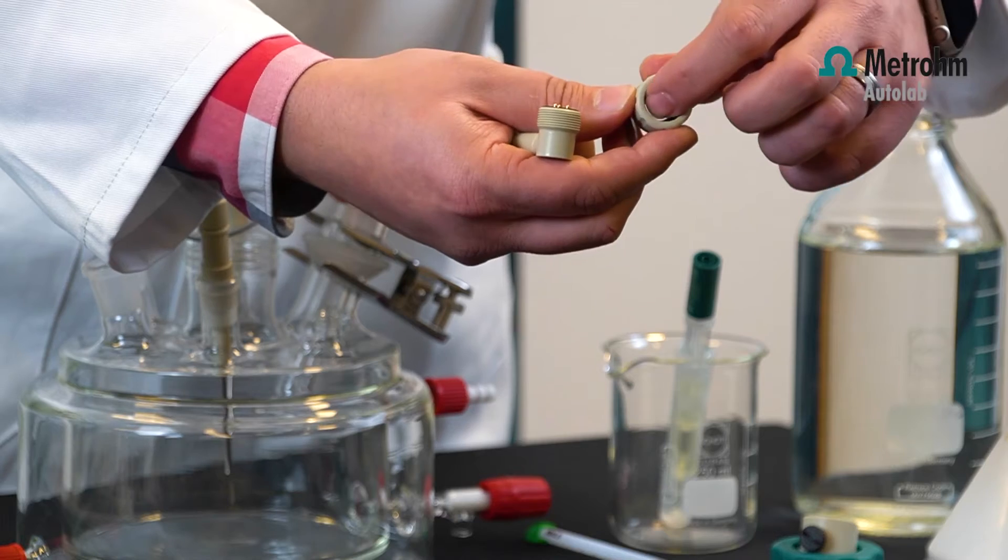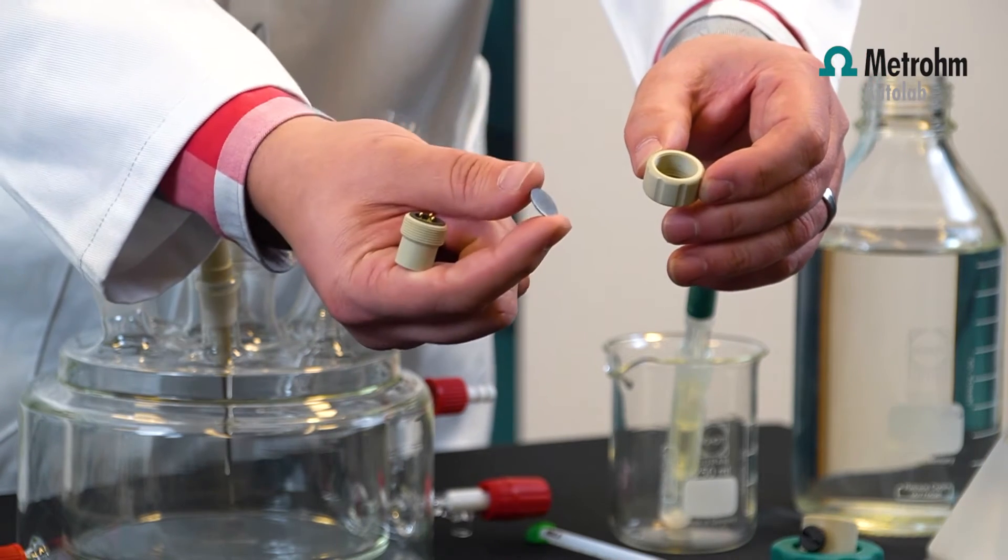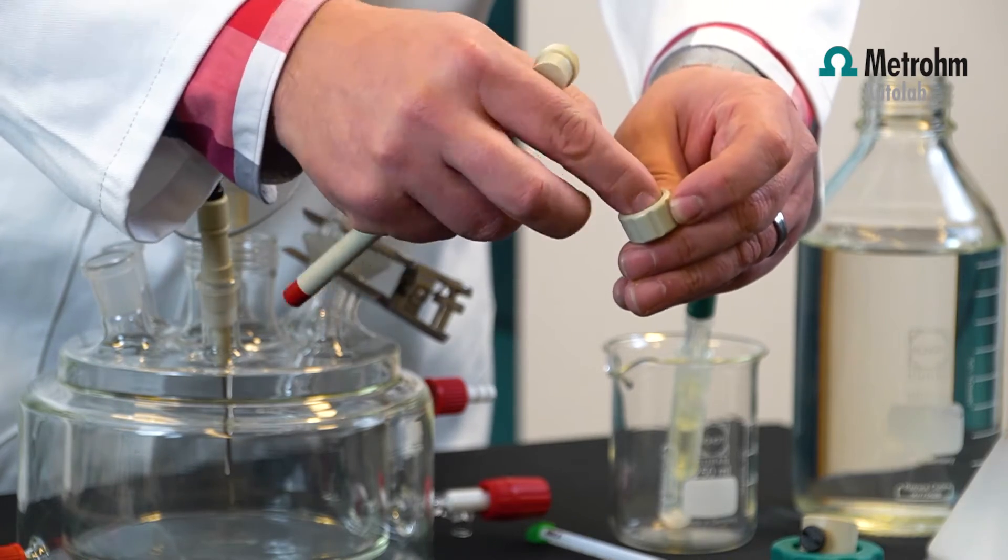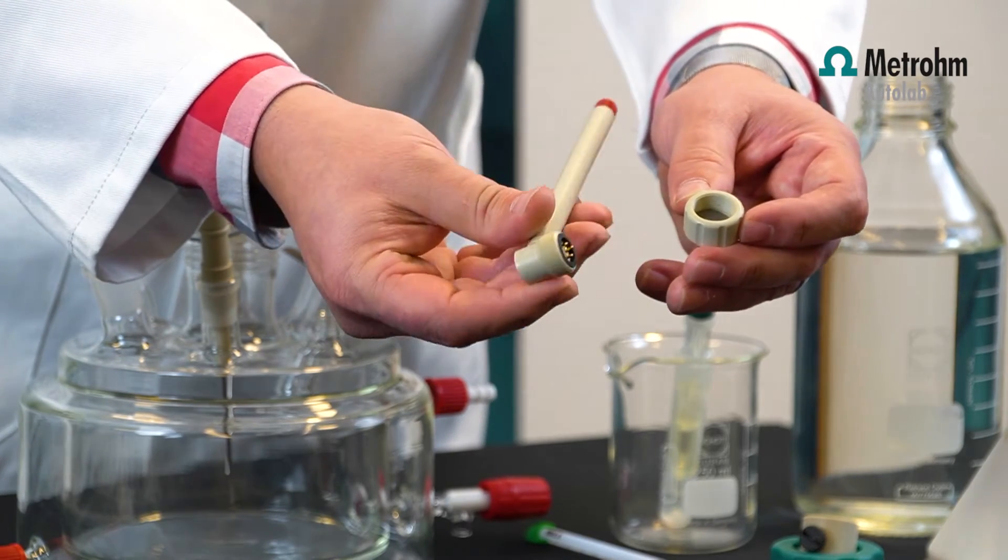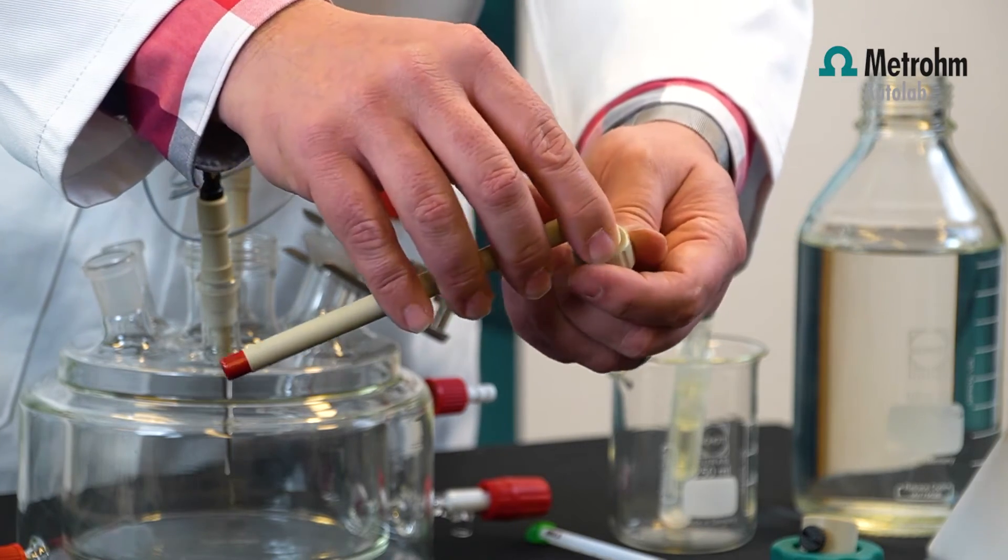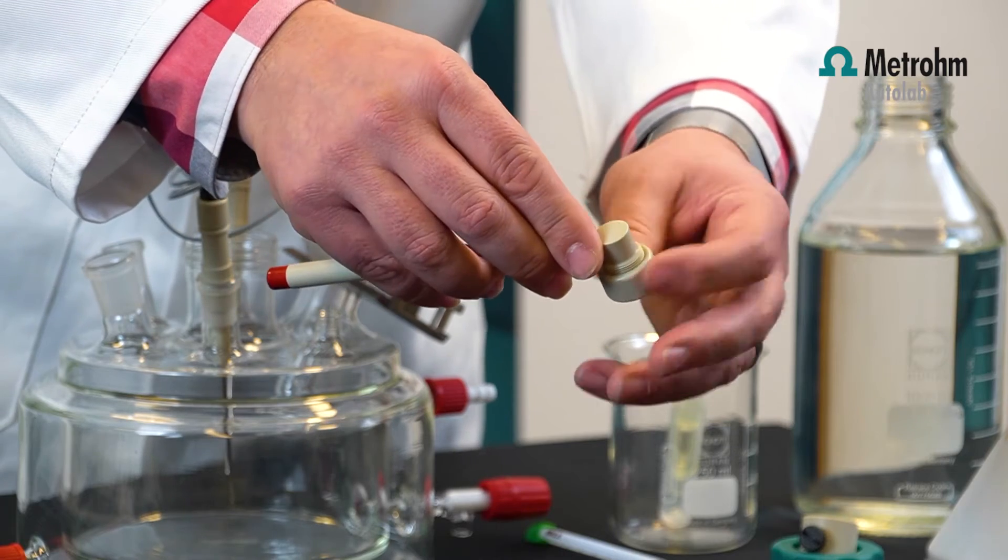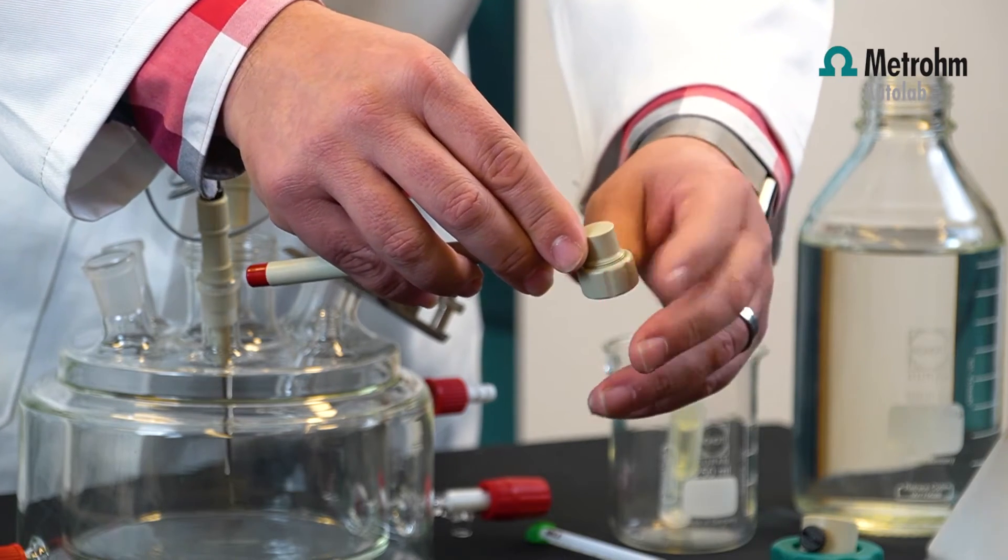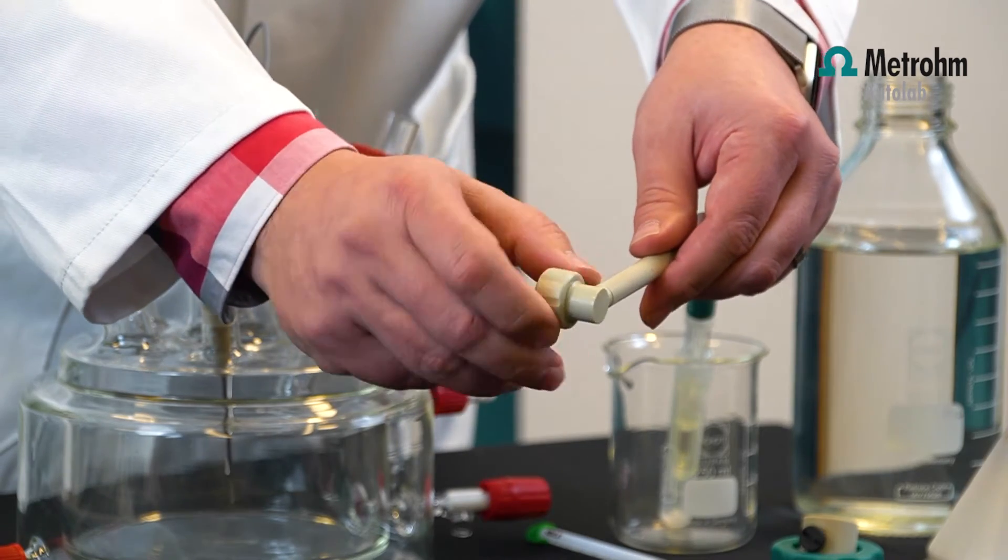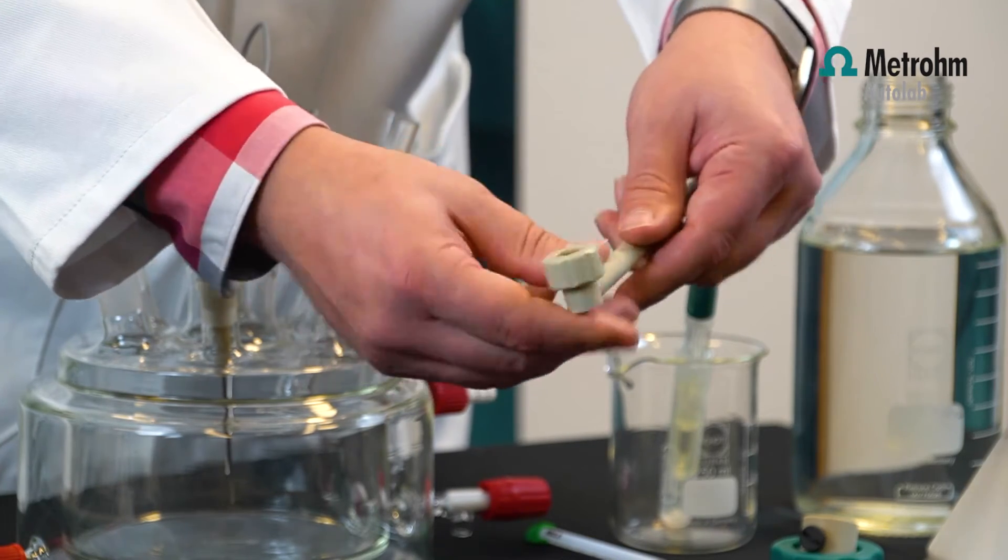First you put an o-ring in the holder. You press an o-ring in the cap. Then you put the sample in the cap of the sample holder. Then you screw the cap on the sample holder, just finger tight. Don't use any wrenches or any other tools.